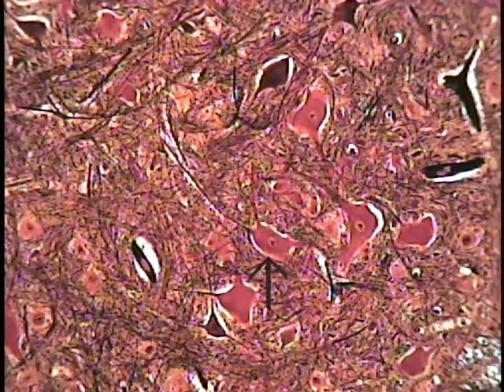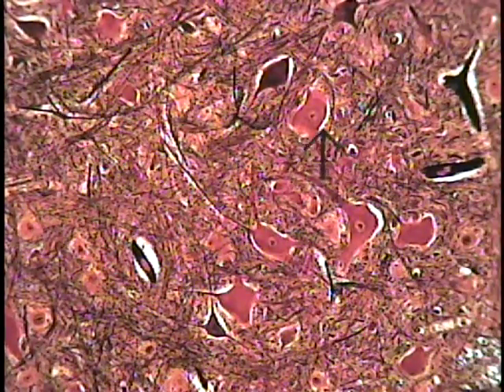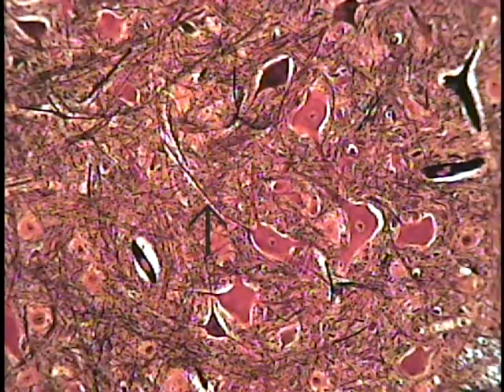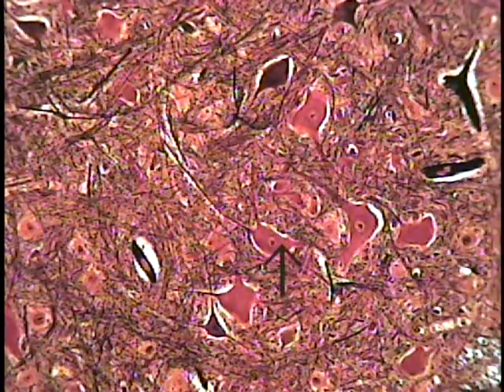Examine these very large cells or neurons for the same cytological features as observed in ova. This is a nerve cell or neuron located at the tip of the pointer. Note that the cytoplasm is drawn out into very large elongated processes called dendrites, or occasionally an axon may also be observed, but we can't distinguish one from the other on this particular section. The nuclear profile can be observed in some of these cells, as well as the dark central round body — the nucleolus — in the center of the nucleus.